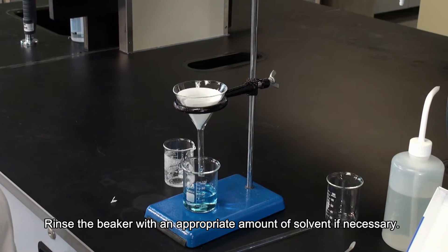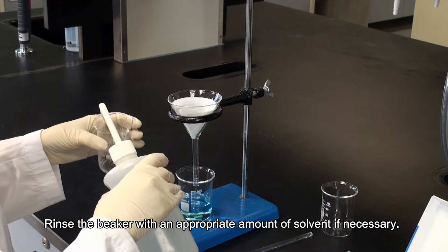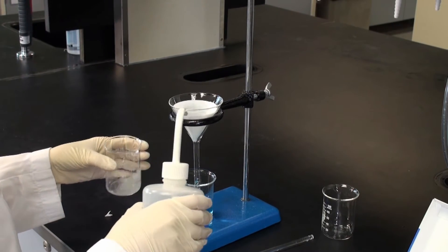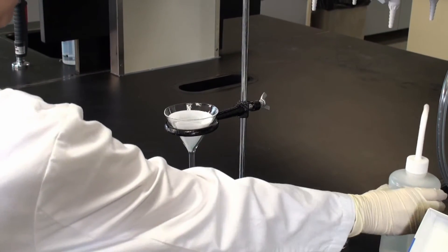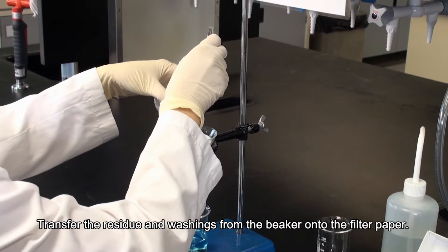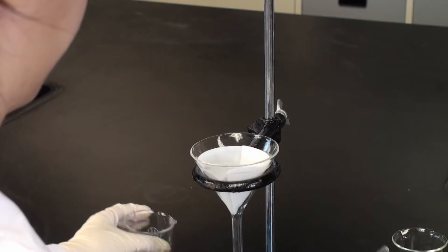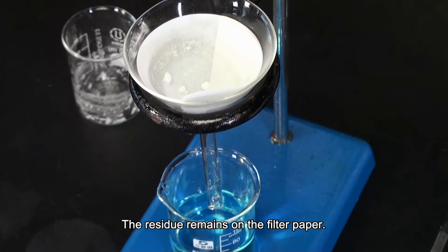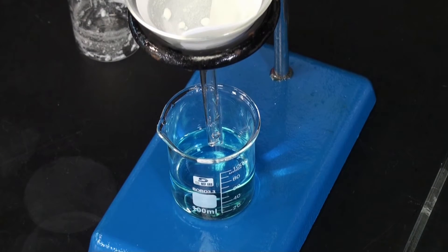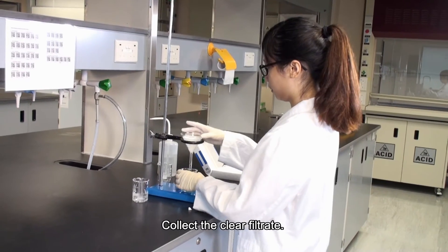Rinse the beaker with an appropriate amount of solvent if necessary. Transfer the residue and washings from the beaker onto the filter paper. The residue remains on the filter paper. Collect the clear filtrate.